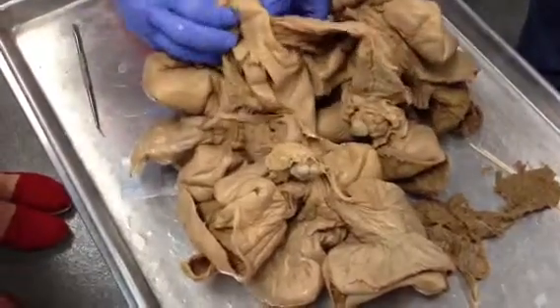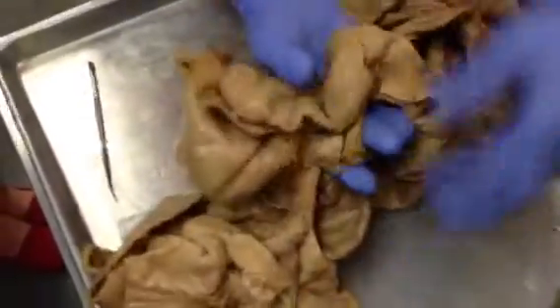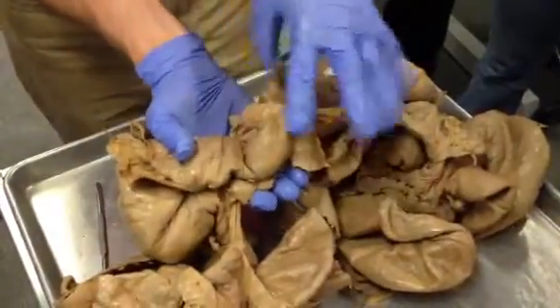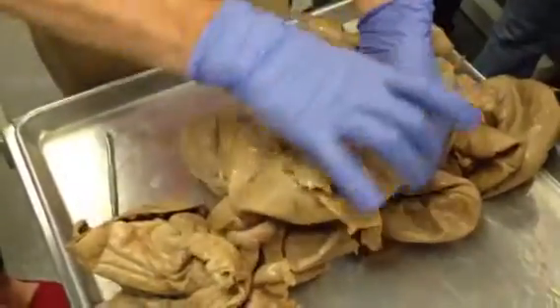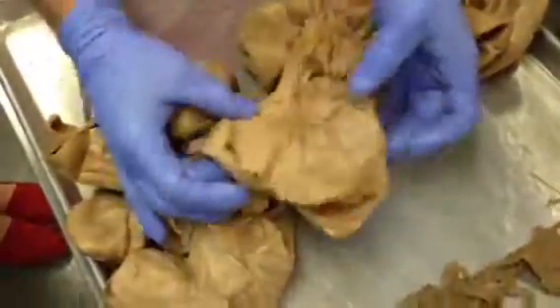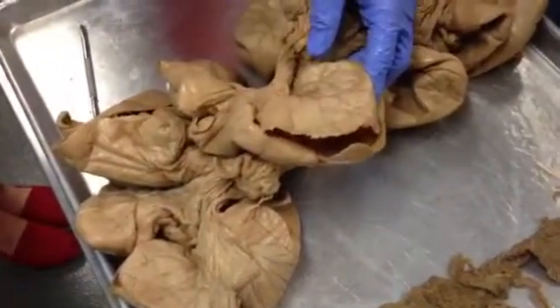And here is the bottom of the Y, and then look where my hand goes, here's where it splits off. You see that? Splits off. Now it has a little more form just when you see my hand coming through the underside. So you see this tube that's kind of thick and wrinkly? That's the uterine horn, and it spirals, so it gets a little twisty, and it's confusing to students. Do you see this big thing, like a big snake almost? That's the uterus, but uterine horn, for a pig.